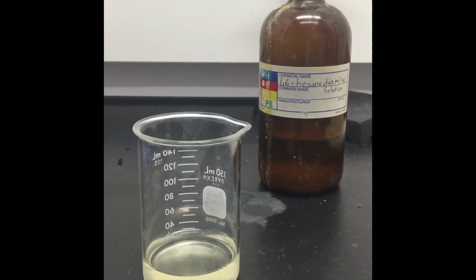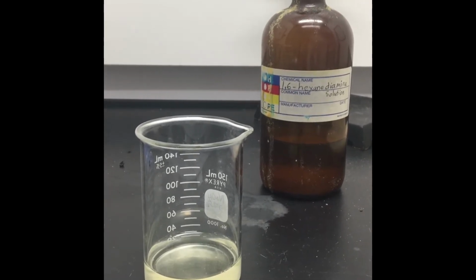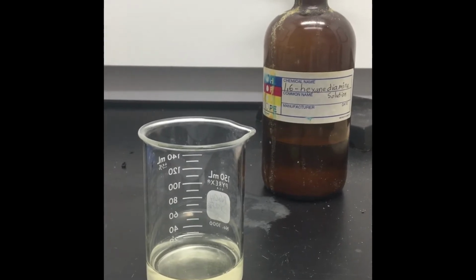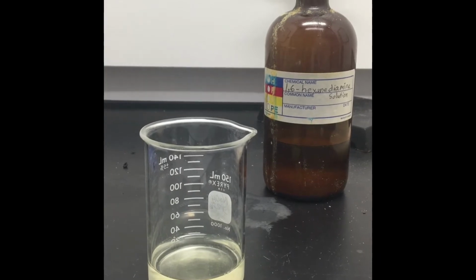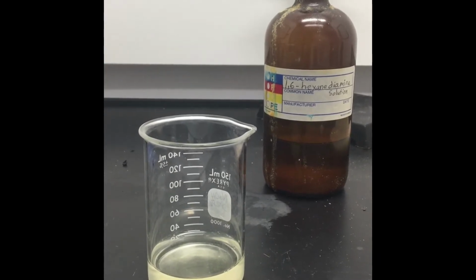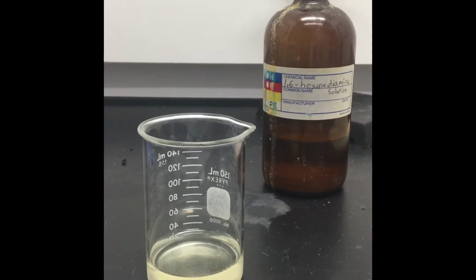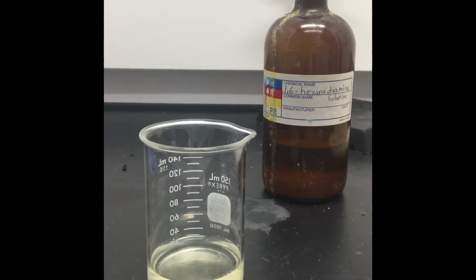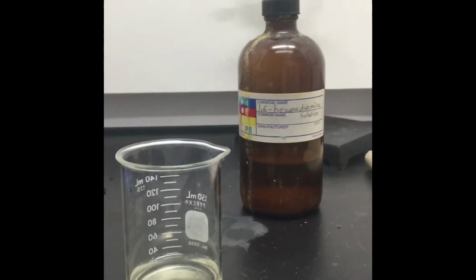One of the ones that we're going to make right now, I'm going to synthesize, is called nylon. You have probably heard of nylon. Nylon is used for fish nets or fishing line, for stockings, for making clothing, for a lot of different things. The one that we're going to make today is called Nylon 66. Nylon 66 is going to be a polymer that is made out of two compounds.